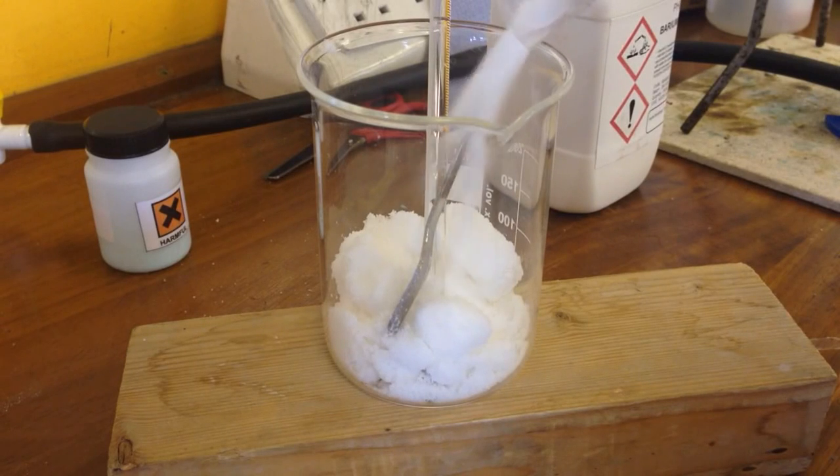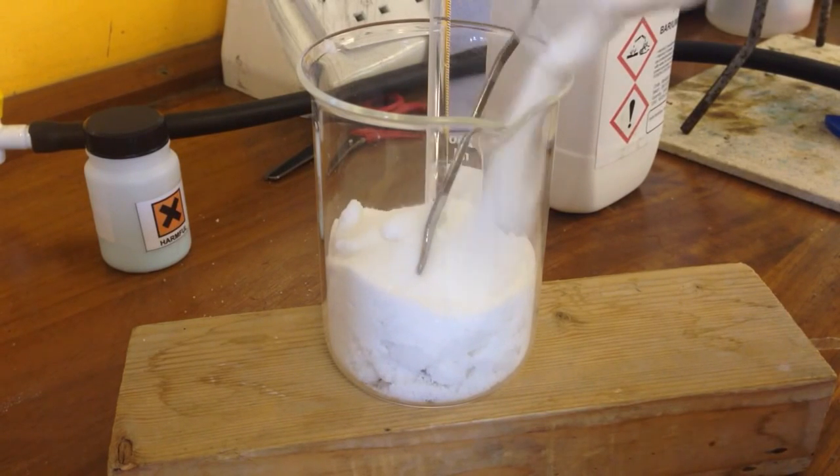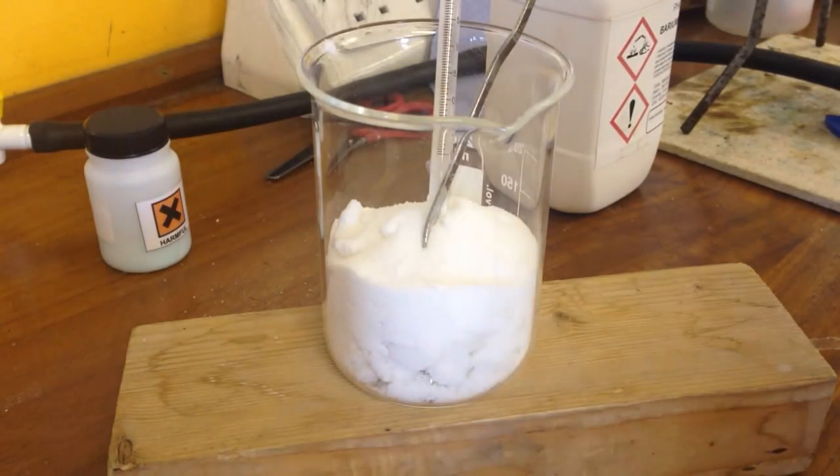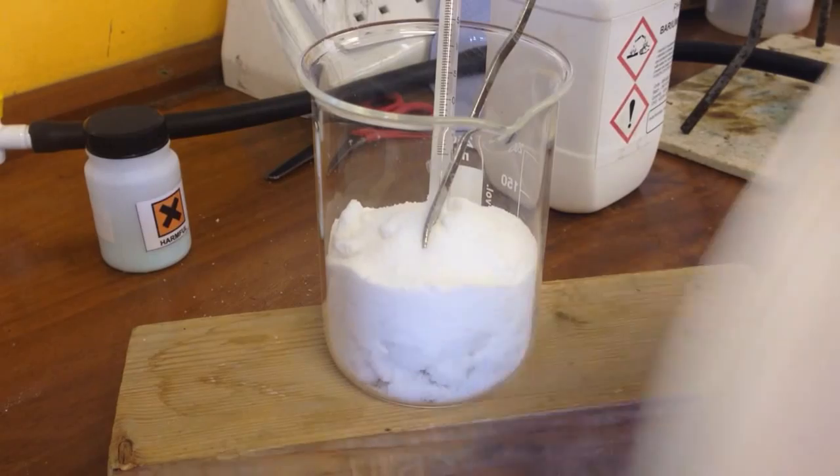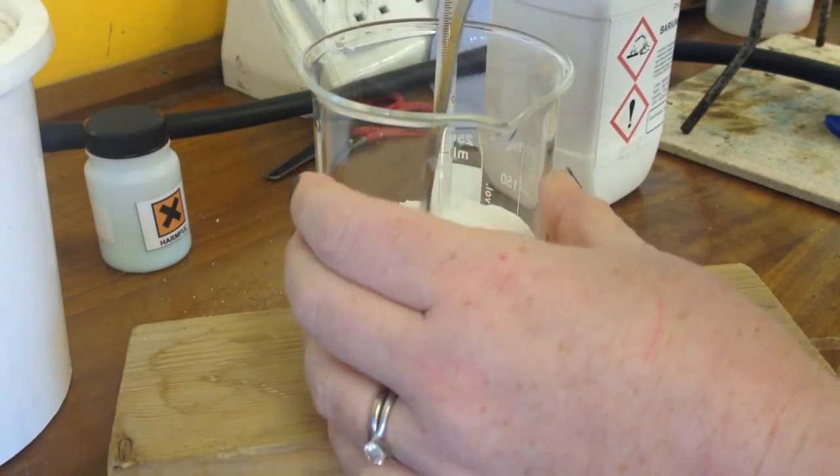And we can see that these two are, at the moment, basically quite a lot of white powders. I'm not very interested in white powders. Quite a lot of stuff comes as a white powder. And they're starting to absolutely stink of ammonia, basically.